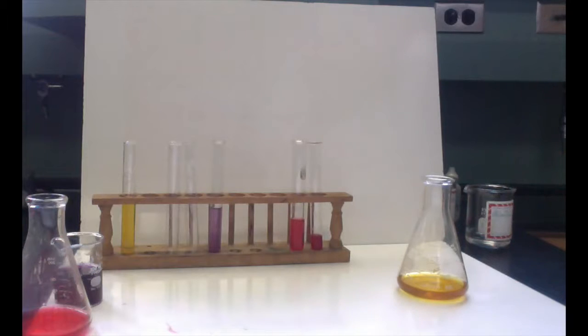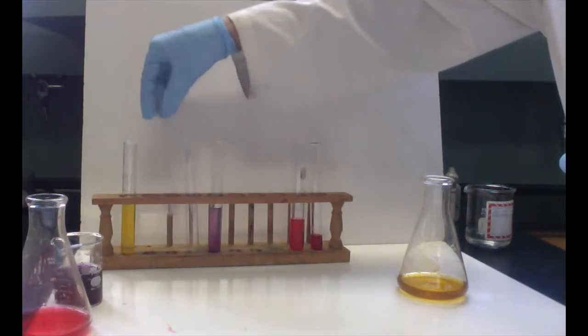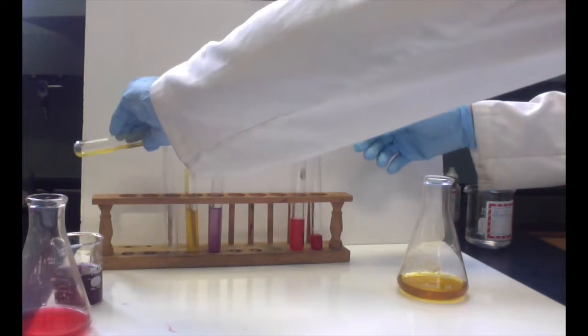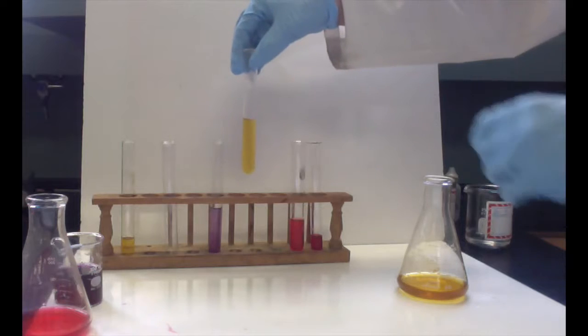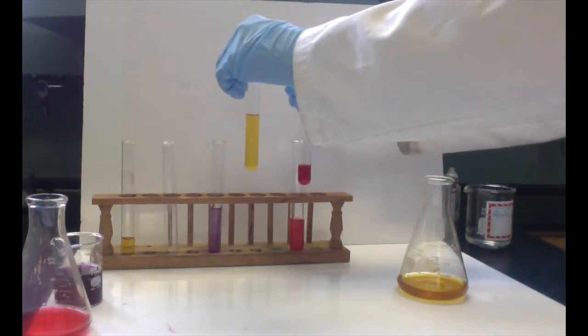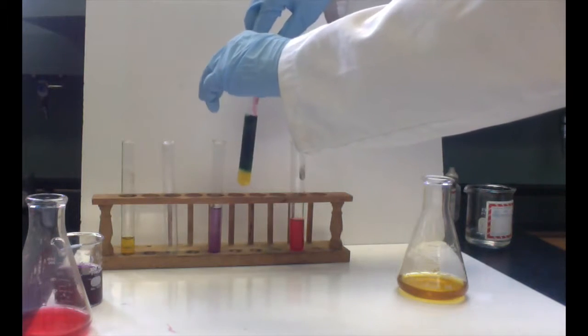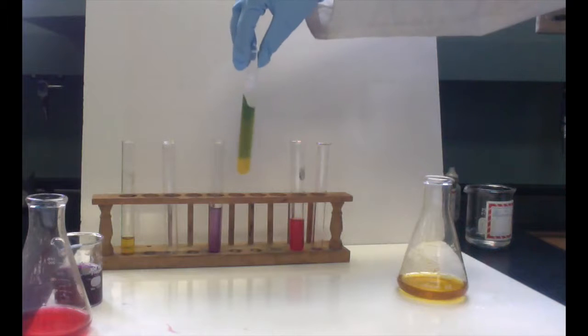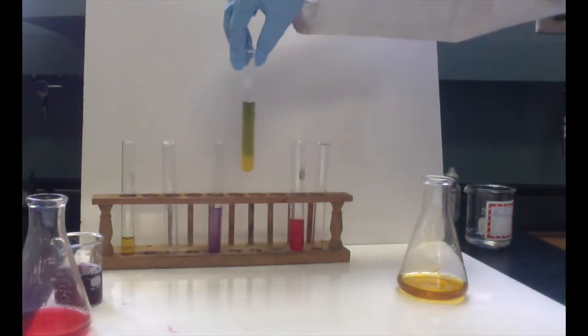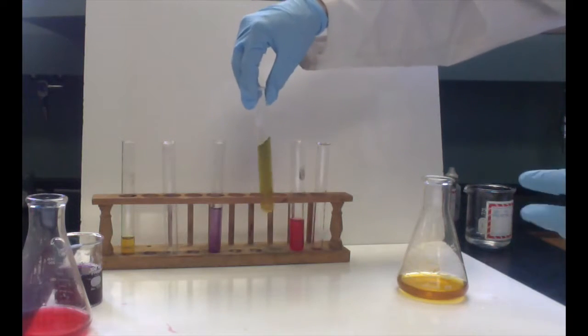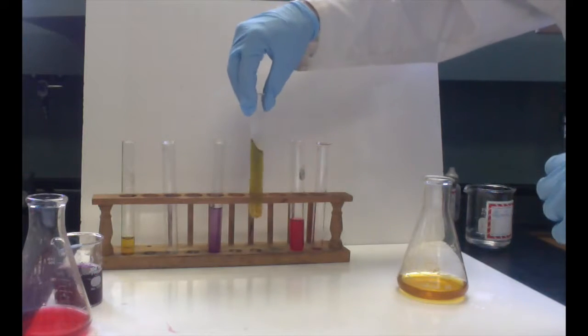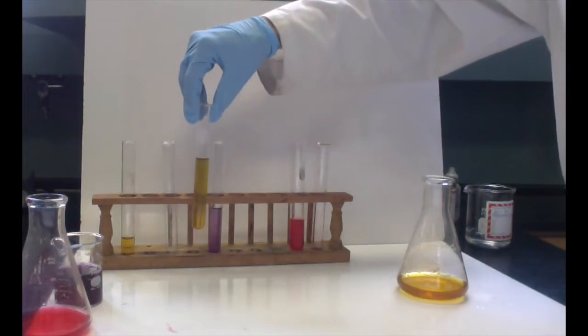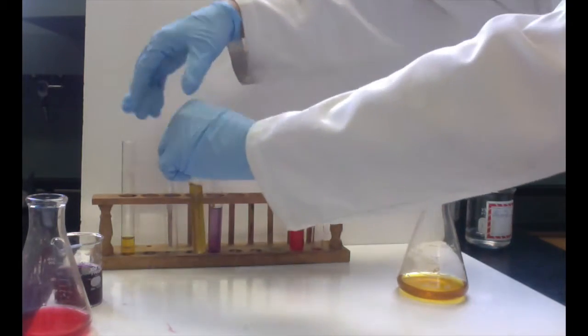So let's just for kicks, find out what happens when we go from the opposite end of the spectrum. So here, we've got our yellowish green. And if we take the far end of this spectrum here, we've got our red, mix them, and look at that. They turned a purple color, so they actually went right to the middle here. Now when this reaction happens, it may start out at 1 pH, and then as you mix it in, they kind of end up on one end or the other. This one sort of started out, moved towards the middle, and then kind of went back out this way. So how much acid would it take for us to get it back into this middle, and then even start turning it over?